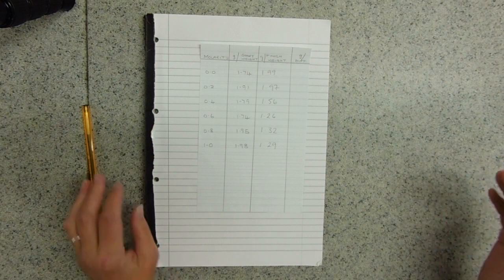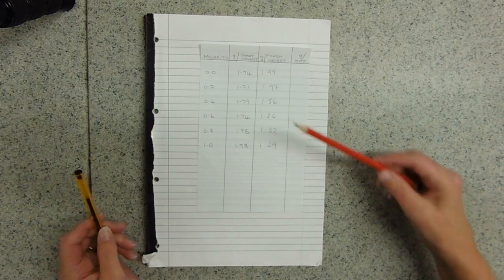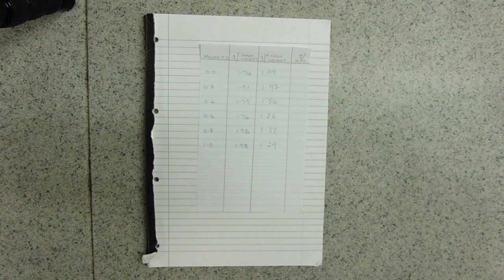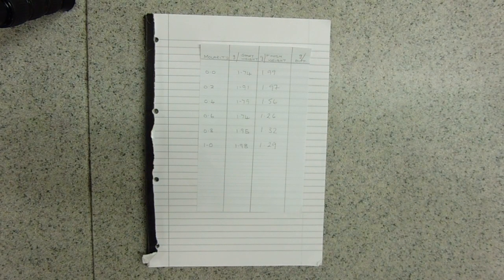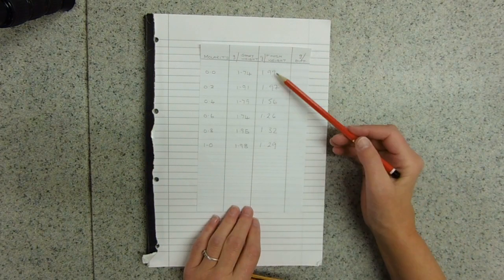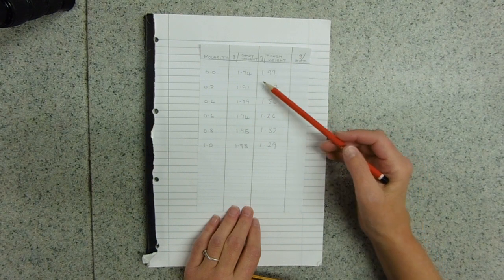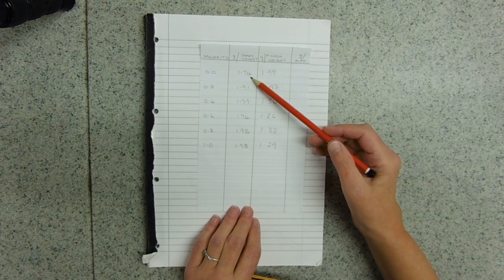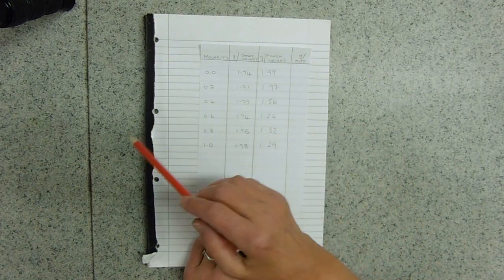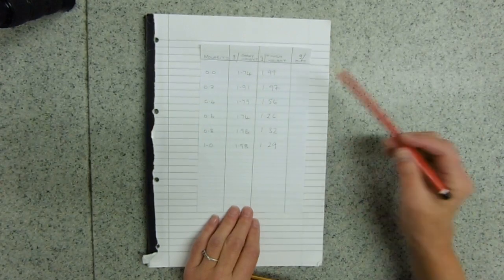It could be that the potatoes are different densities — who knows. But because they've all got different starting masses, this one looks like they've put on the same mass, but this one has come from a much further point away than this one has.